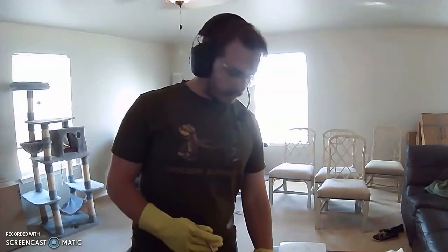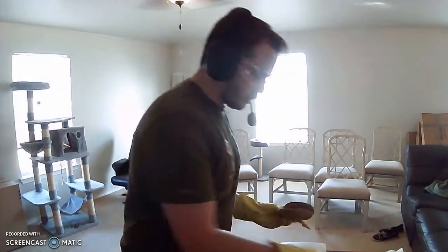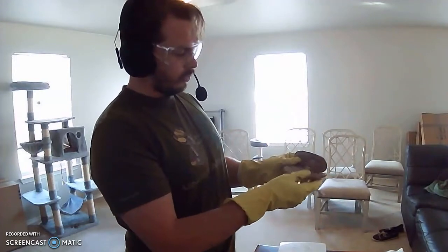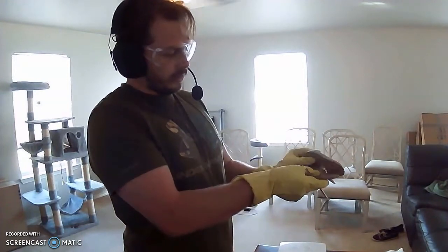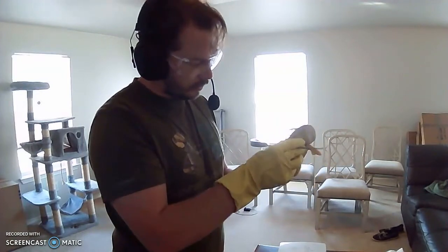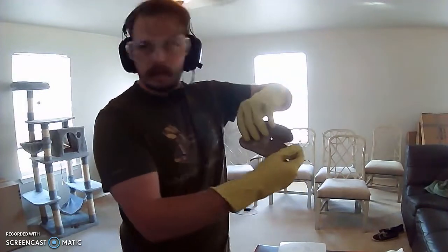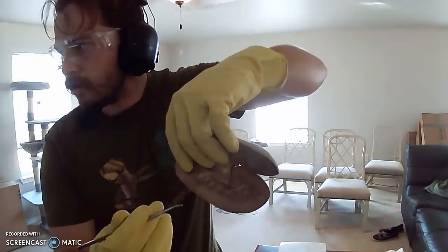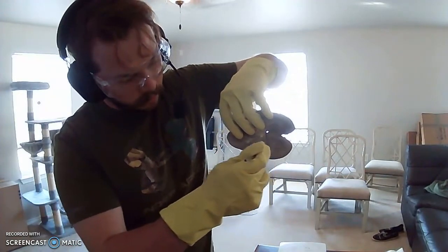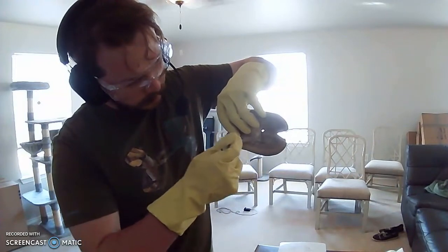Now, I sliced this kidney open in such a way that it's adjacent to the ureter and the renal pelvis, but it also includes a dissection or a slice through the middle. And we'll kind of identify some of these structures inside of the kidney. Okay, so right here, this lighter band right here, we have something called the renal cortex. Right in here.